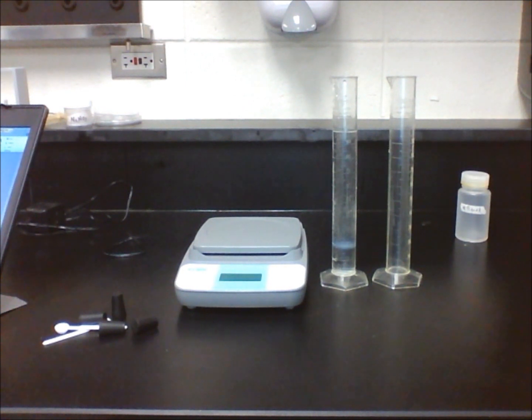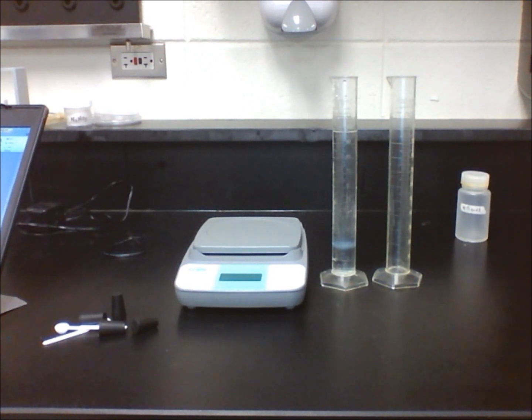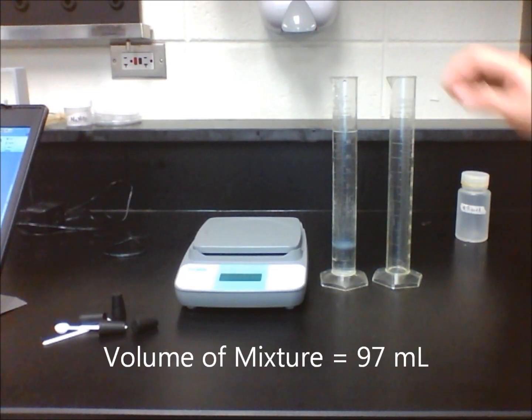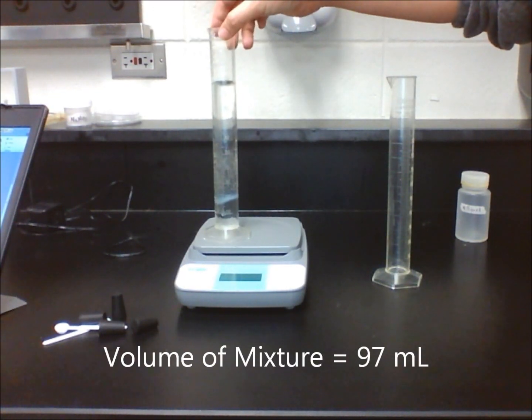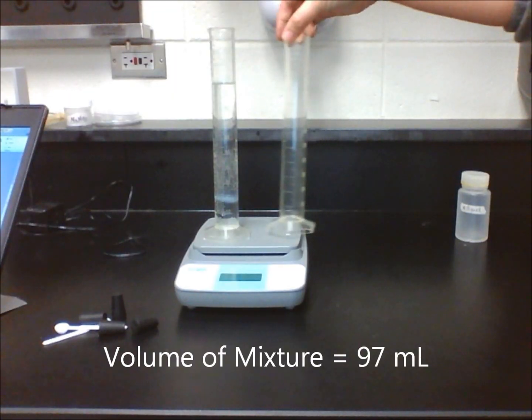Read the graduated cylinder at eye level to see what the volume is for the mixture. Put the ethyl alcohol and water mixture as well as the empty cylinder on the balance to find the total mass.